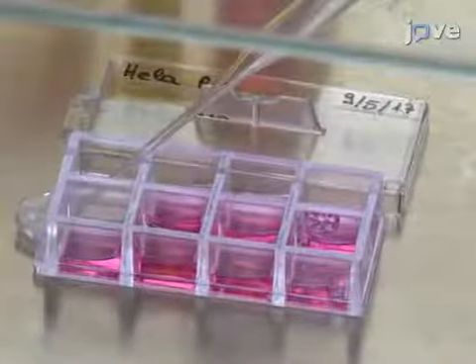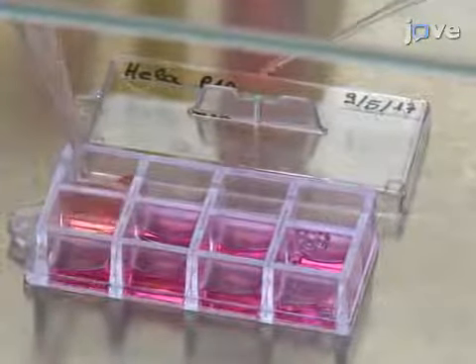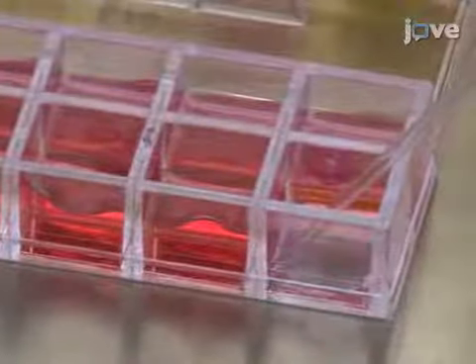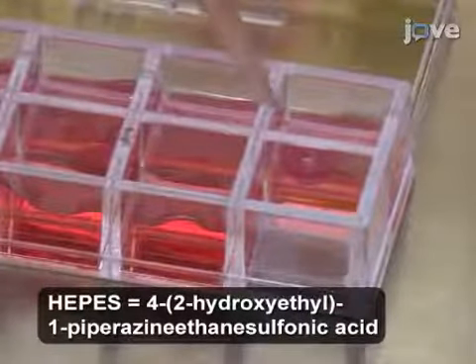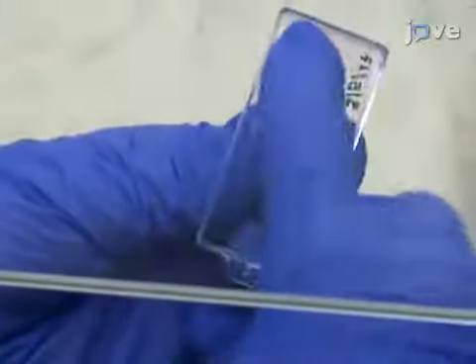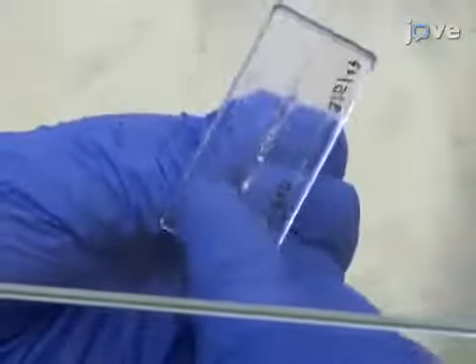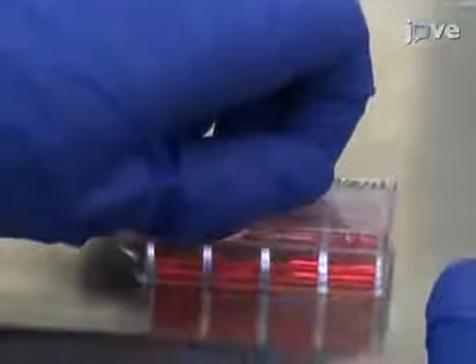Following incubation, fill the cell culture chambers up to 90% with 37 degrees Celsius pre-warmed medium containing 20 millimolar HEPES to reduce changes in pH and osmolarity due to evaporation during image acquisition. To seal the lid, apply a thin layer of vacuum grease on the inside of the lid and gently press it on the culture chamber containing the transfected cells.